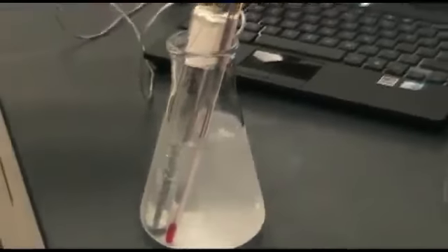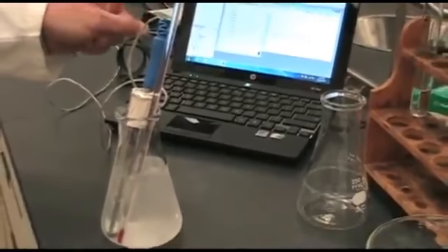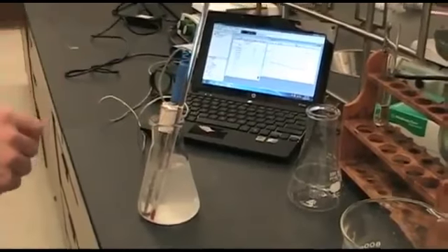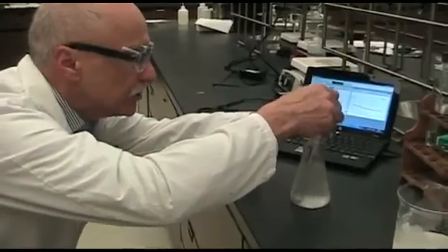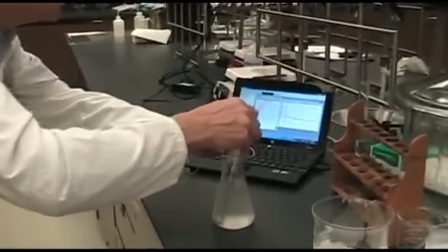And then you'll see that when I start stirring it, the temperature will go up a bit, since I'm putting some heat and friction into the solution. I'm just checking to see if there are any crystals forming yet. And if you look at the chart, now that I'm stirring it, you can see that it's gone up a bit. We were at below zero a little bit, or just at zero.